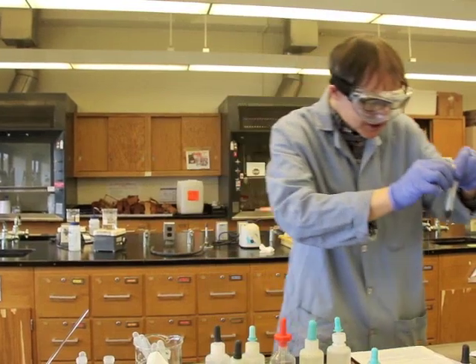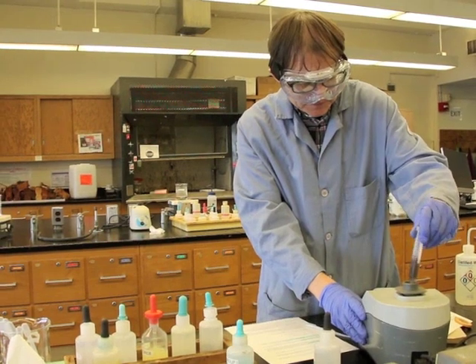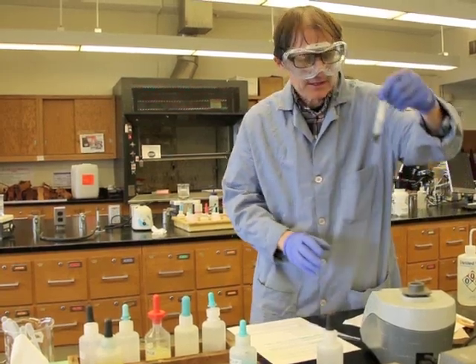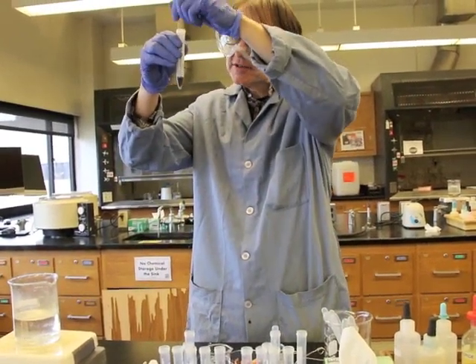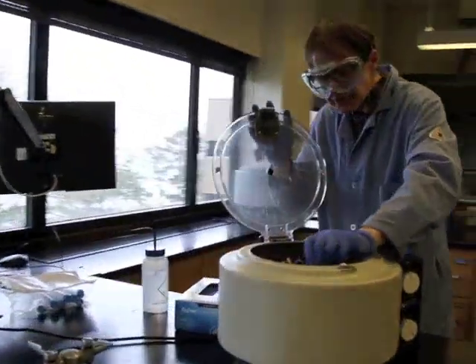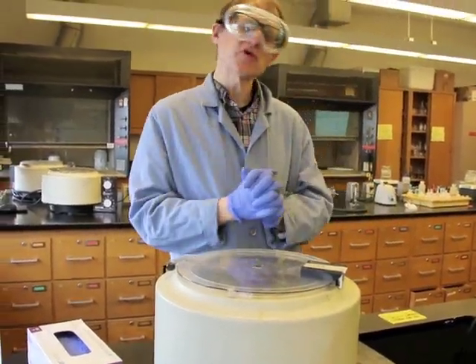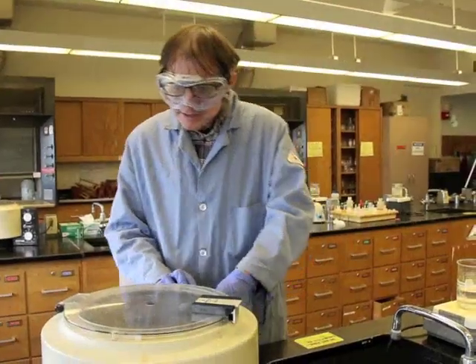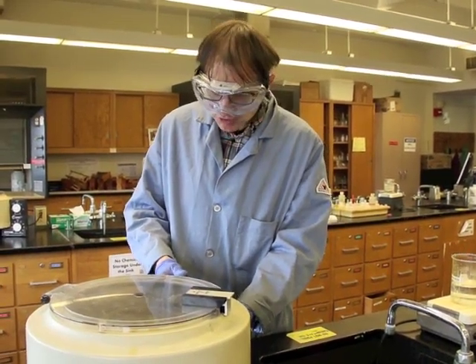Now we come back, we're going to mix this up using the vortex mixer. Okay, again, there's a little bit of solid down at the bottom, so why not take advantage of the glass stirring rod and make sure that that's mixed in well. Now we'll come back, we'll separate, and if we get a black solid at the bottom, that tells us that the unknown also has bismuth. Bismuth 3 ion was the original ion to form that. Okay, so now we have our unknown testing for bismuth. Let's take a look and see if we get our result here.